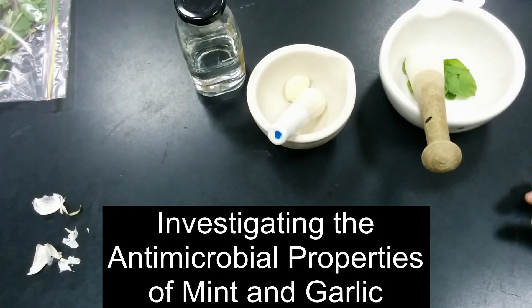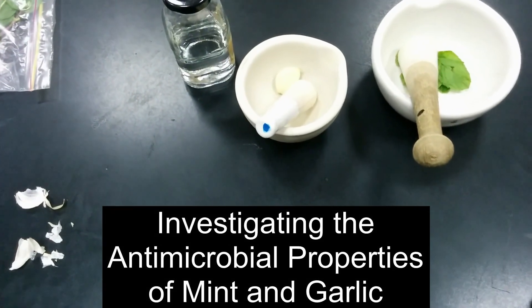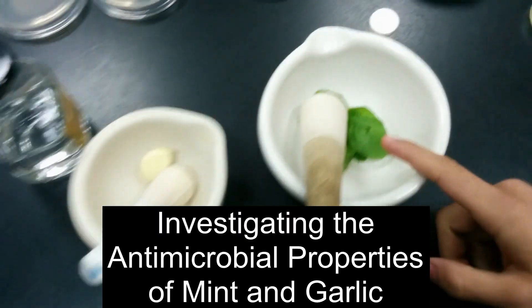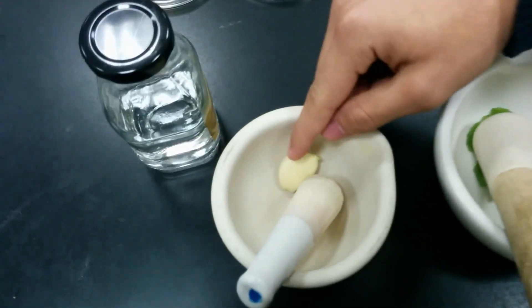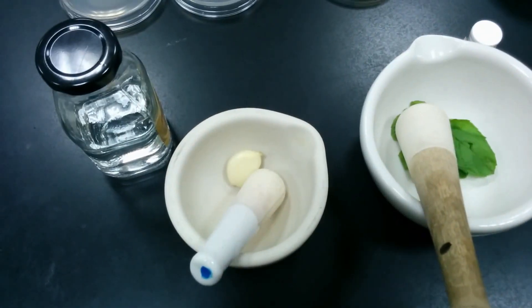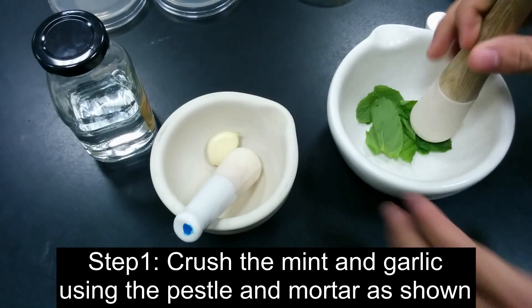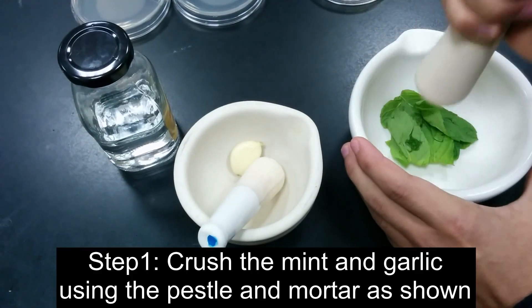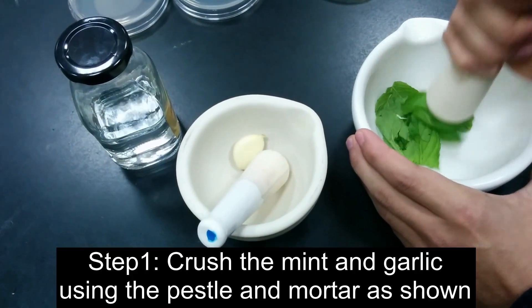Okay, today I'm going to investigate the antimicrobial properties of mint and garlic. So, first thing, we have to crush the mint leaves.